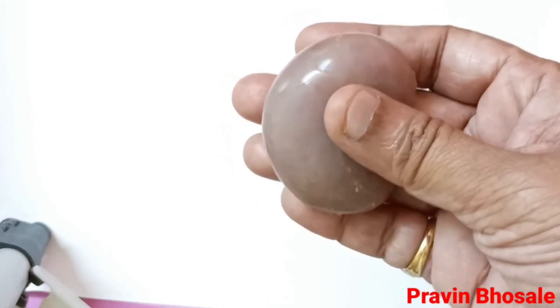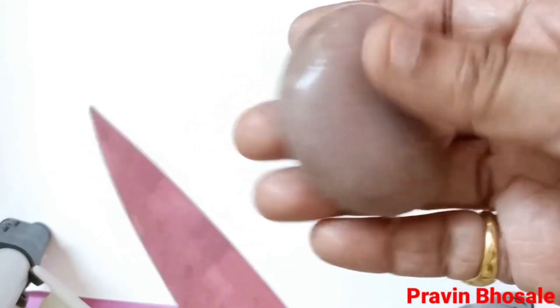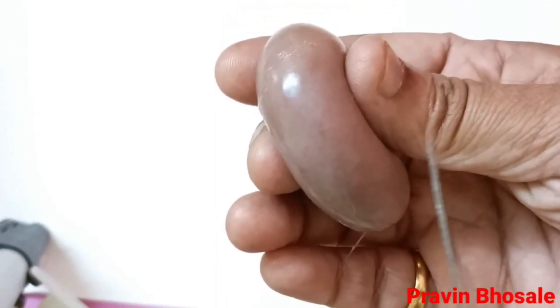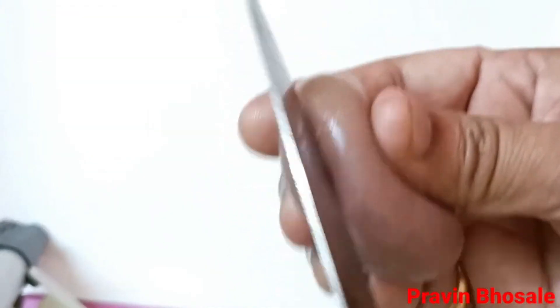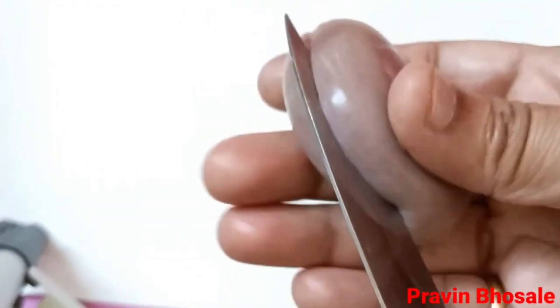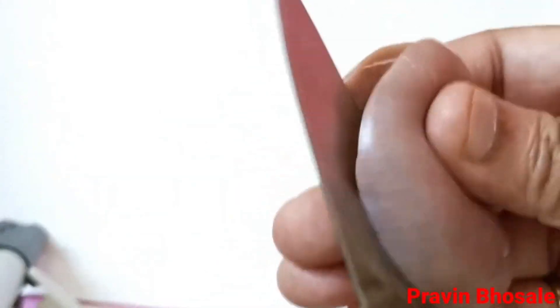So now let's start with the dissection of the kidney of goat. To take the longitudinal section, I am taking a longitudinal cut. I have taken a longitudinal cut, so we can see the LS of the kidney.